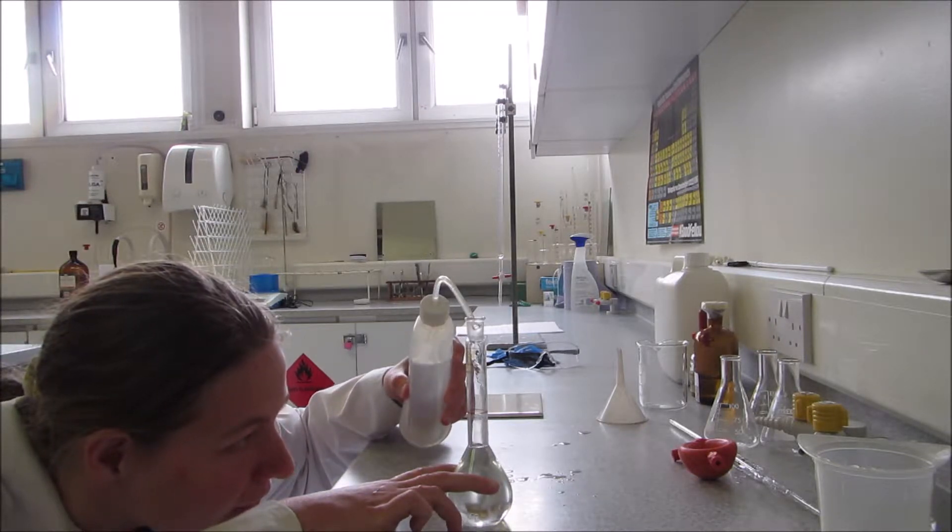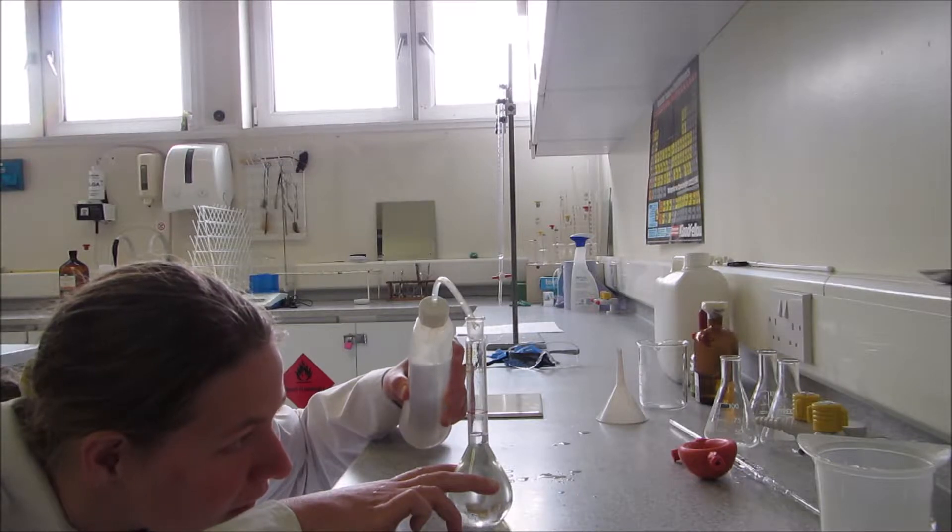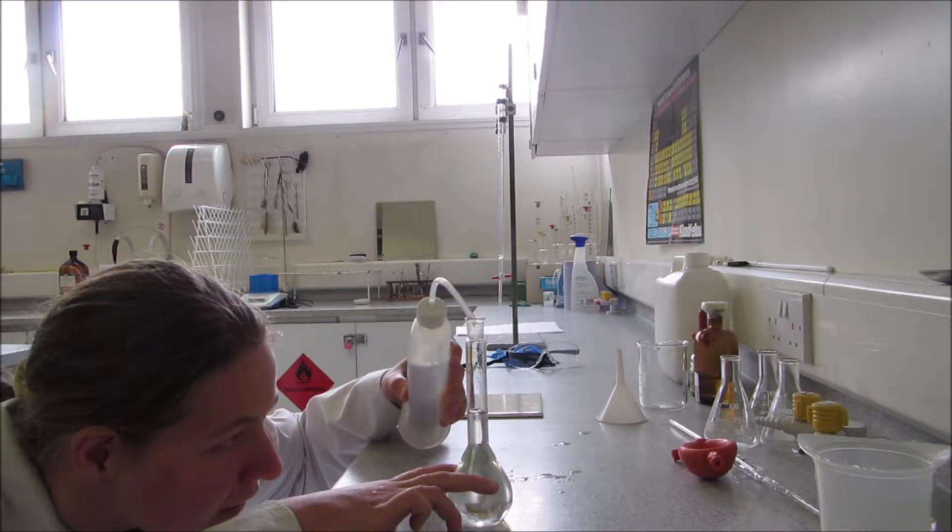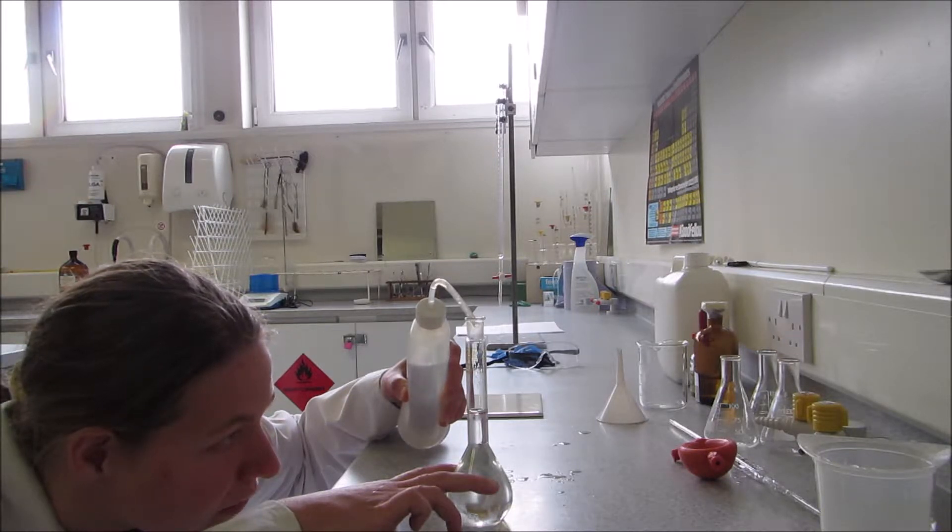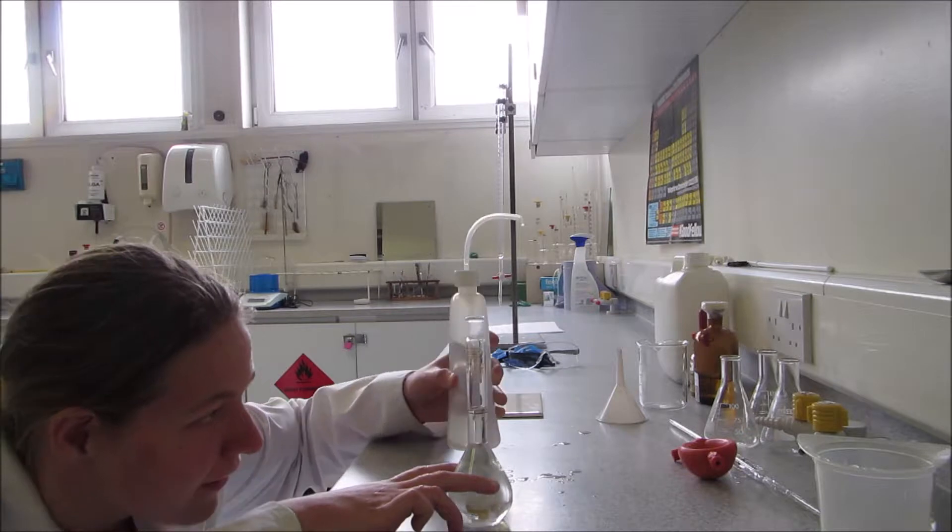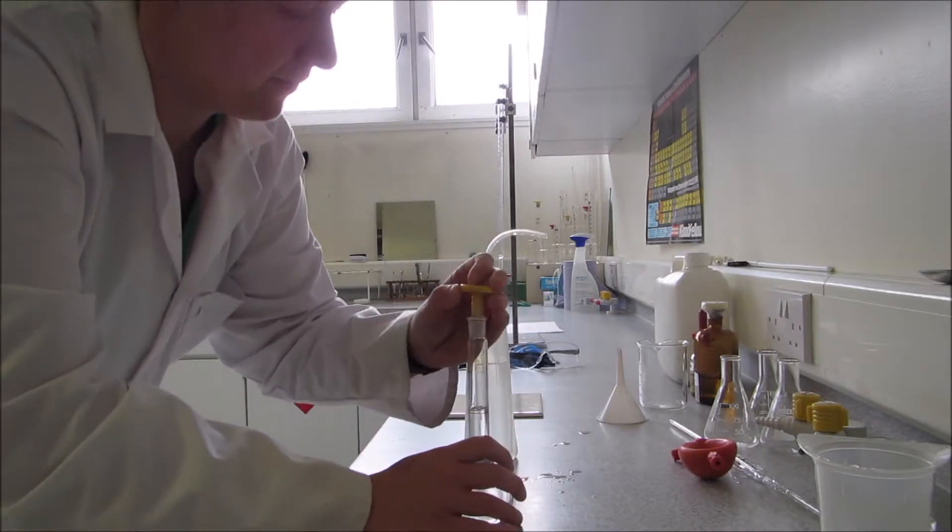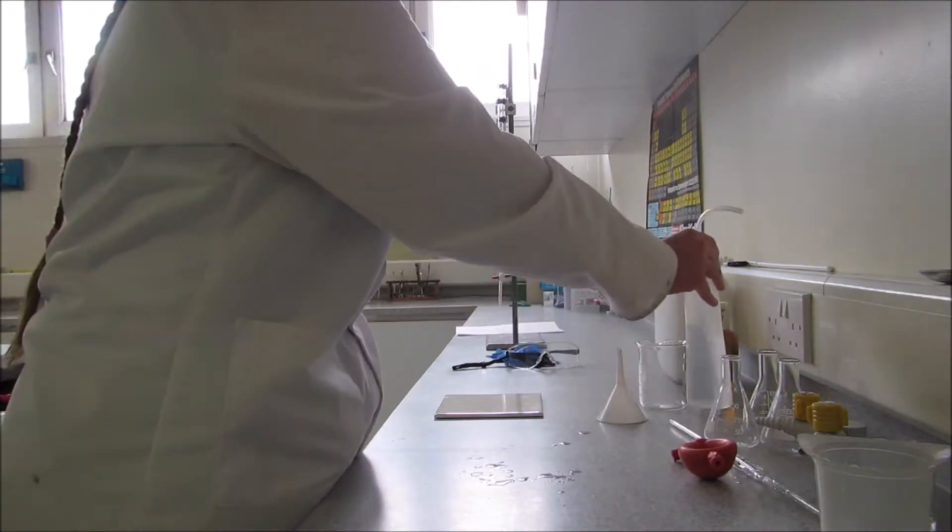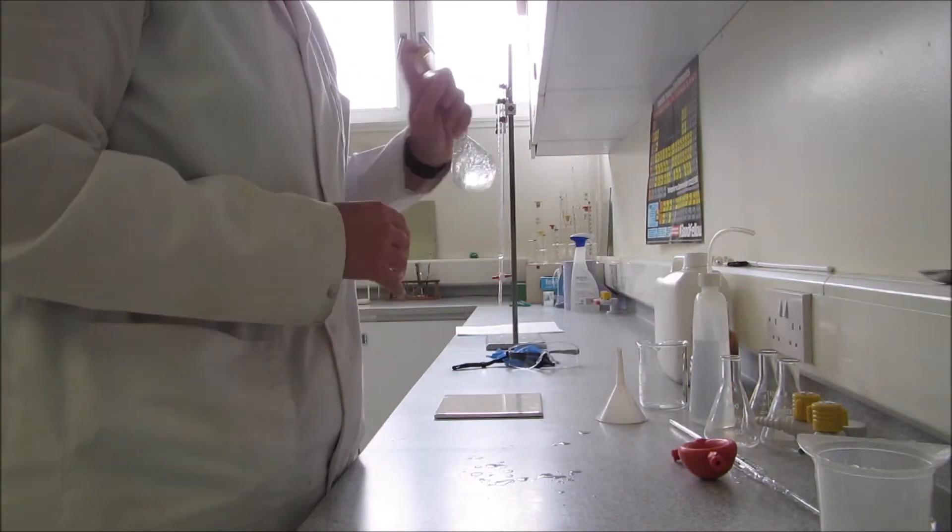You want to keep your eye level with it so you can see the bottom of the meniscus. I'll just give it a mix.